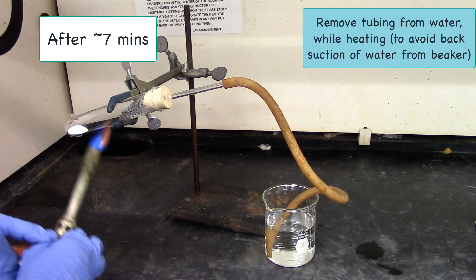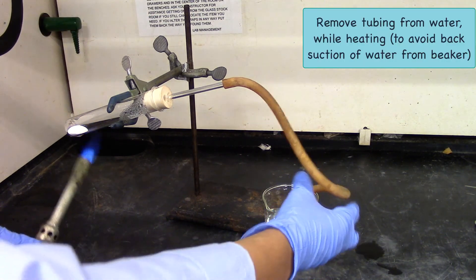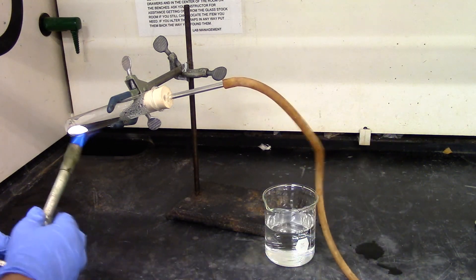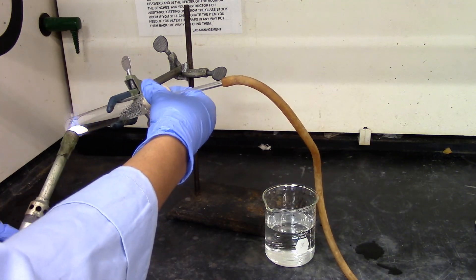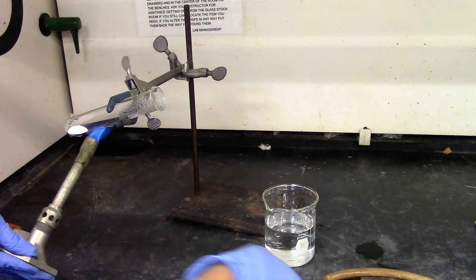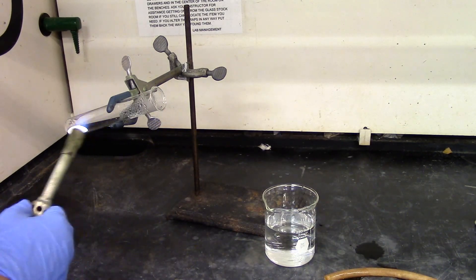So the bubbles have stopped. I'm going to take out the tubing. Open the stopper and heat the test tube for the moisture to dry.